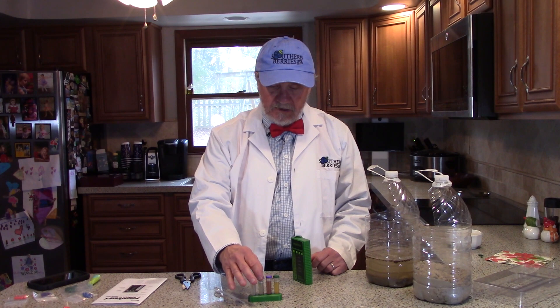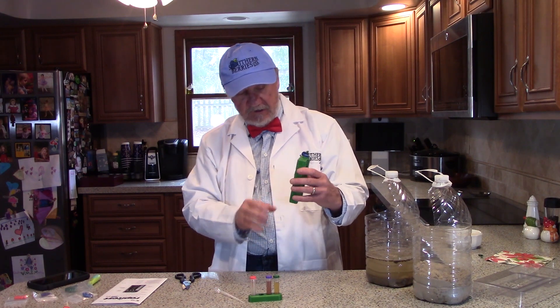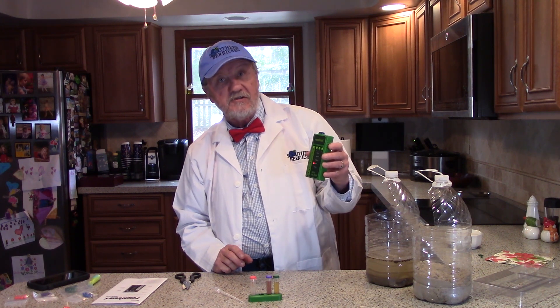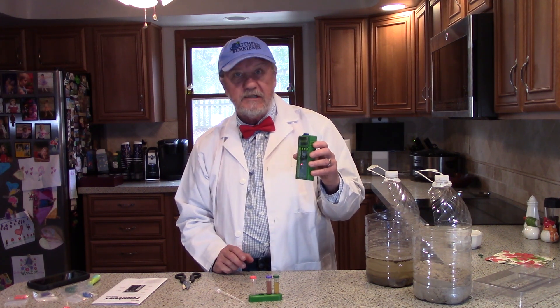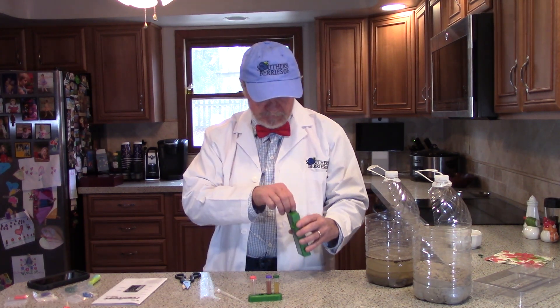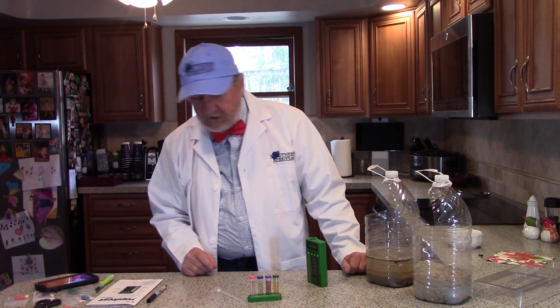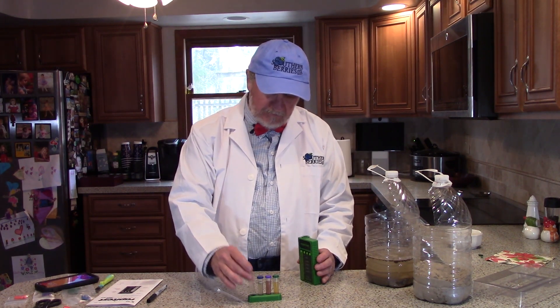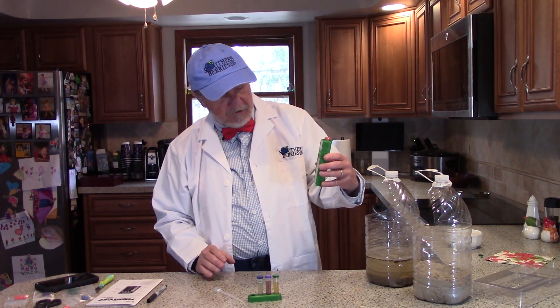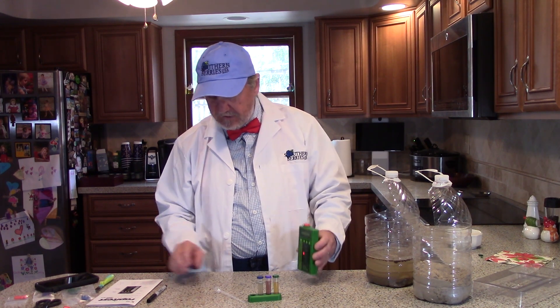It's time to test the sample for the phosphorus. Once again, slip it into the tester and push the button for phosphorus — and it's showing that this is deficient. So this means I'm going to need to add some amendments to the soil in my field to keep my plants healthy. Timer's up for the potash. Take the vial, slip it into the tester, and push the results for potash — and this is showing adequate.